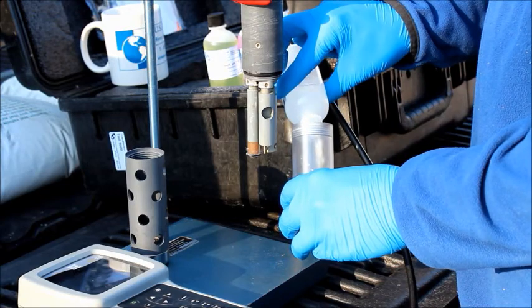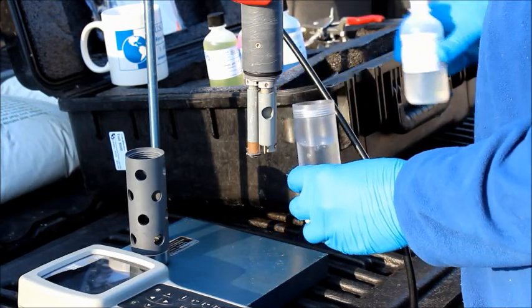When calibrating, remember to use enough calibration solution so that the sensors are completely submerged.